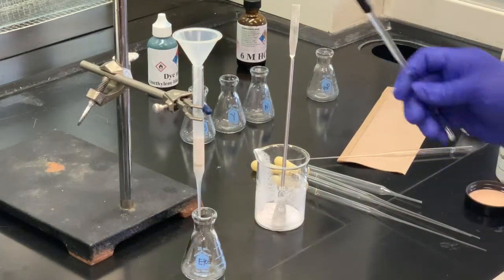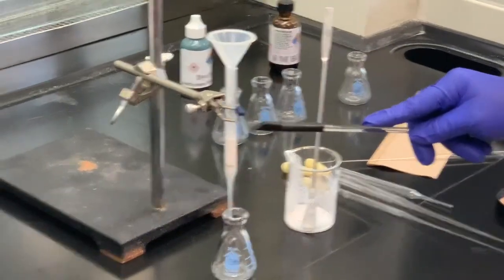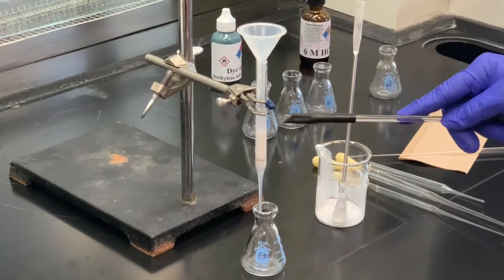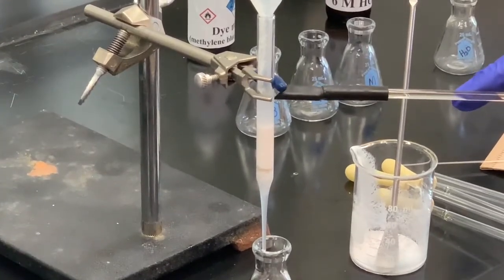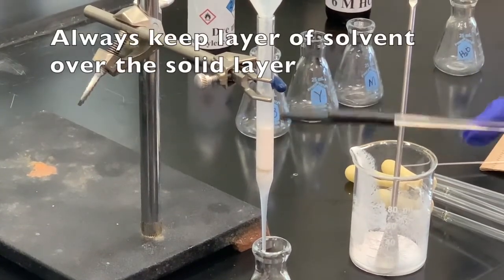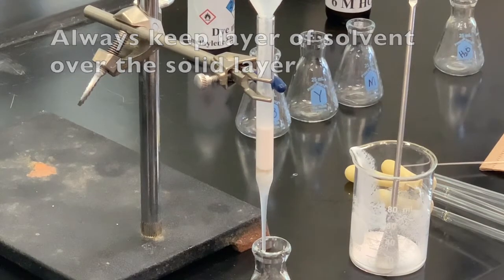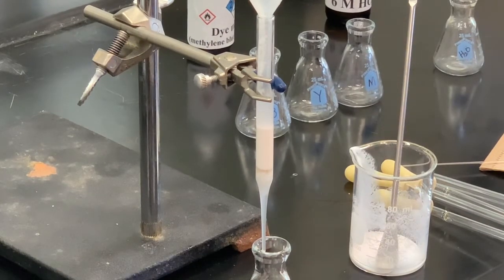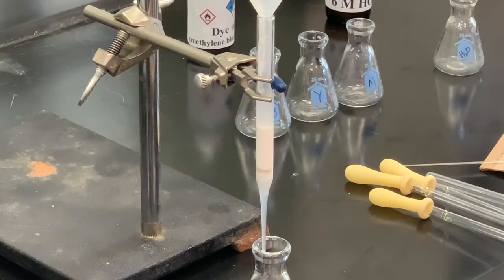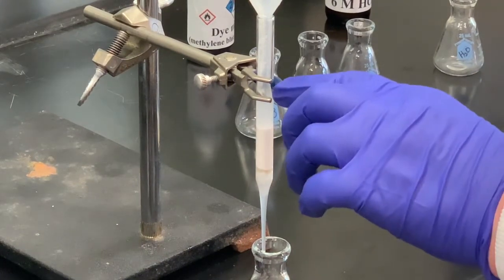Now, I think you can probably see there is a layer of the liquid above. We always want to keep the layer of the solvent well above the layer of our adsorbent. And I'm going to add some more because I want this to be a little bit higher up.